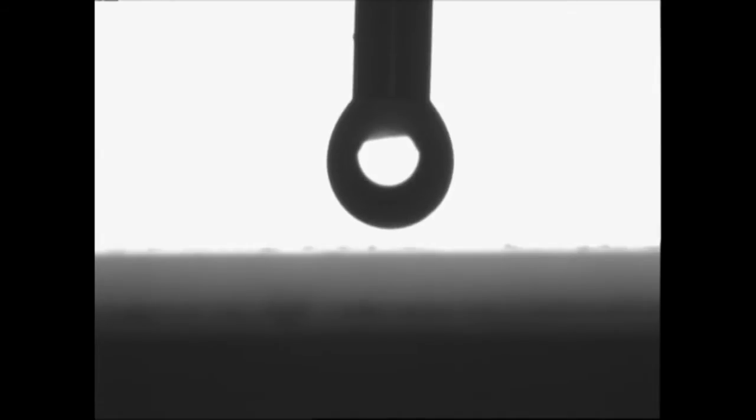We can now begin to make the deposition. Once the droplet is in contact with the surface, we begin to slowly withdraw the syringe to minimize splashing.